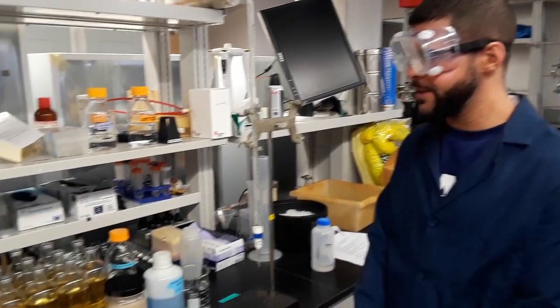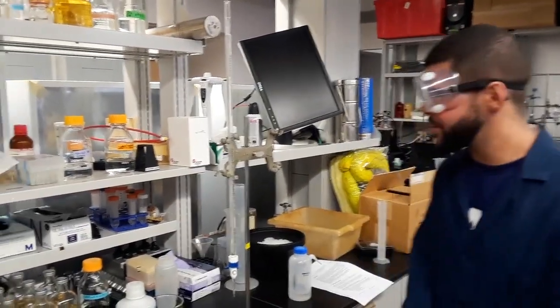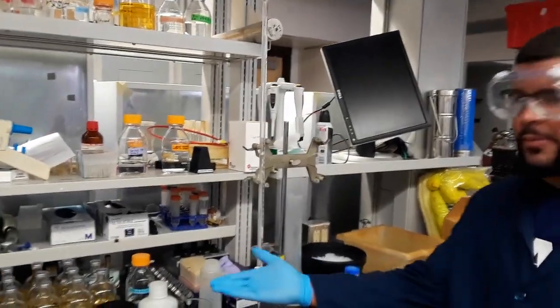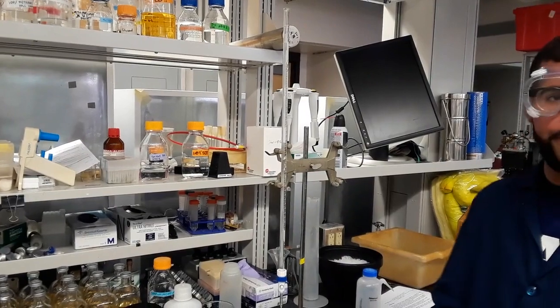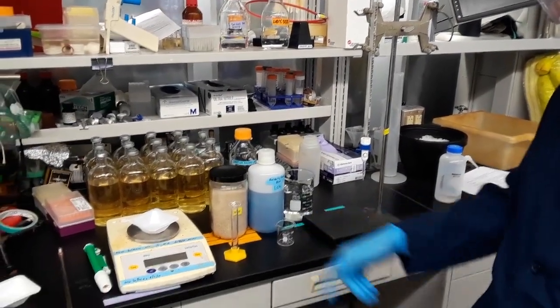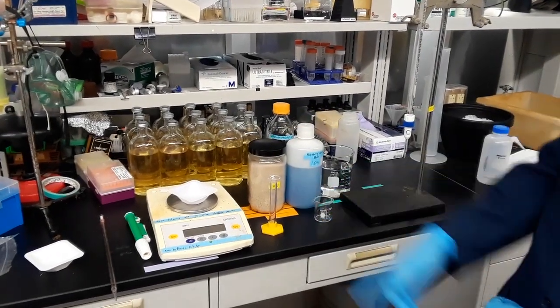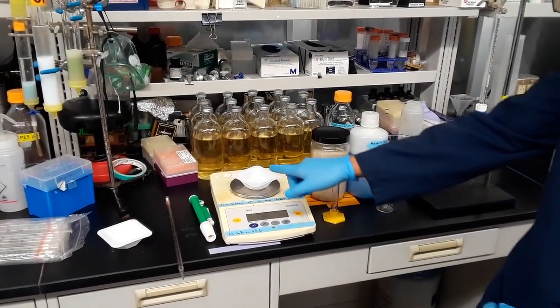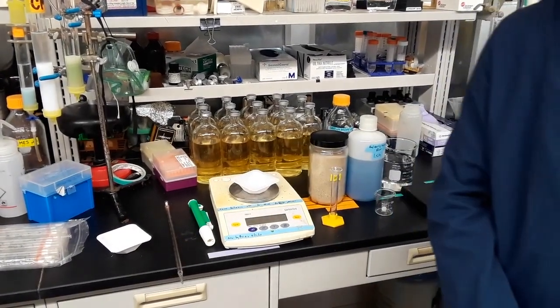I'm going to be telling you guys about how glassware is used in lab investigation. So what you see here are the pieces of equipment that you're going to need for the lab. Starting to the right we have the burette, and then we have a beaker, 600 milliliter, then a 50 ml beaker. We got our food coloring solution in sand, a graduated cylinder. We got a scale and weighing boats. And we also have a graduated pipette and a serological pipette.